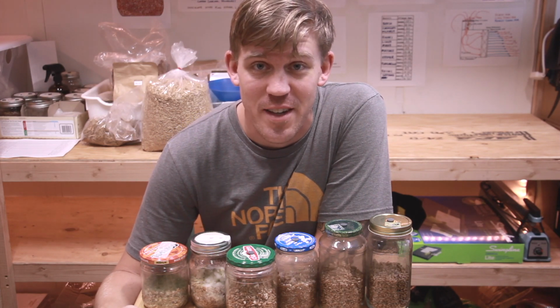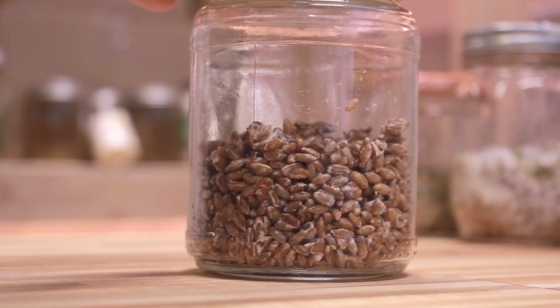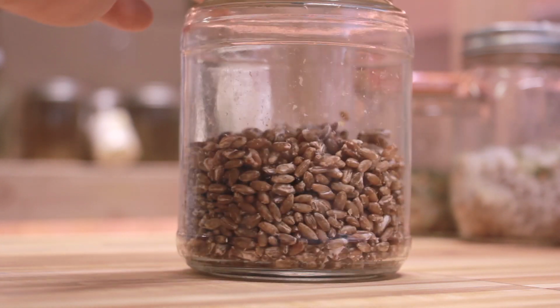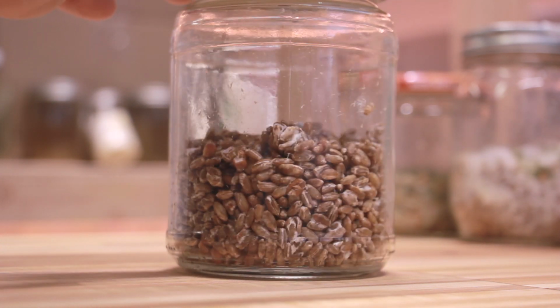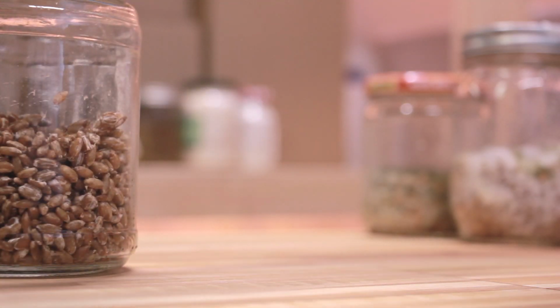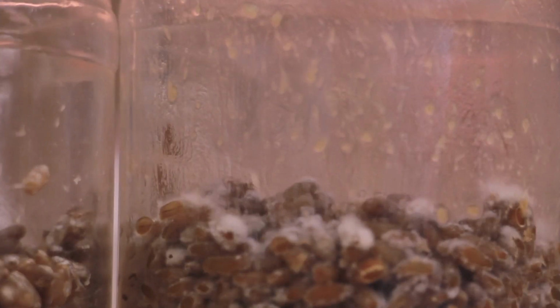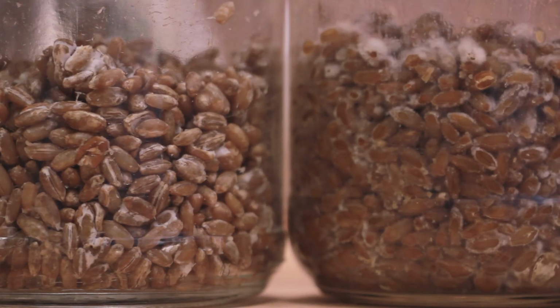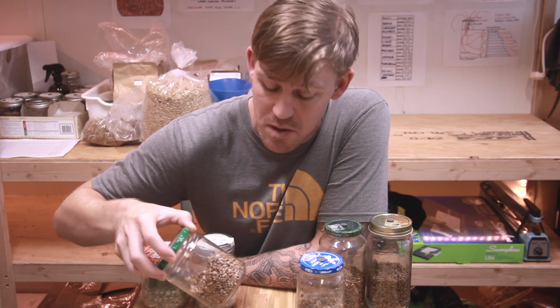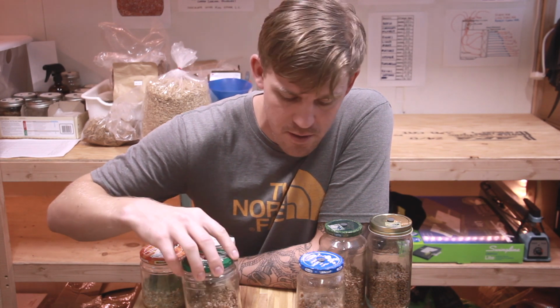Okay, so it actually looks like I was wrong about jar number 3. After the shake, I'm looking at the grains, and it looks like you would expect grain to look after a shake. When I shook jar number 4 a couple of days ago, it was just a big soupy mess. But this, the moisture content is looking fine. The growth of the hyphae, the mycelium, was looking beautiful all the way throughout. It was nice and white all the way on the inside.